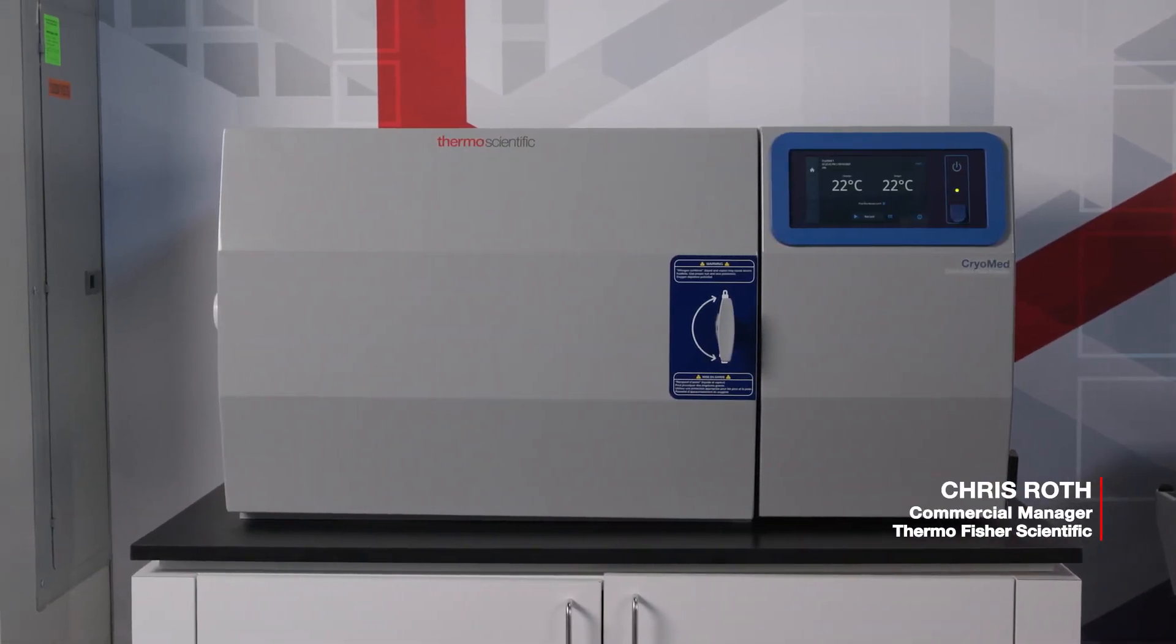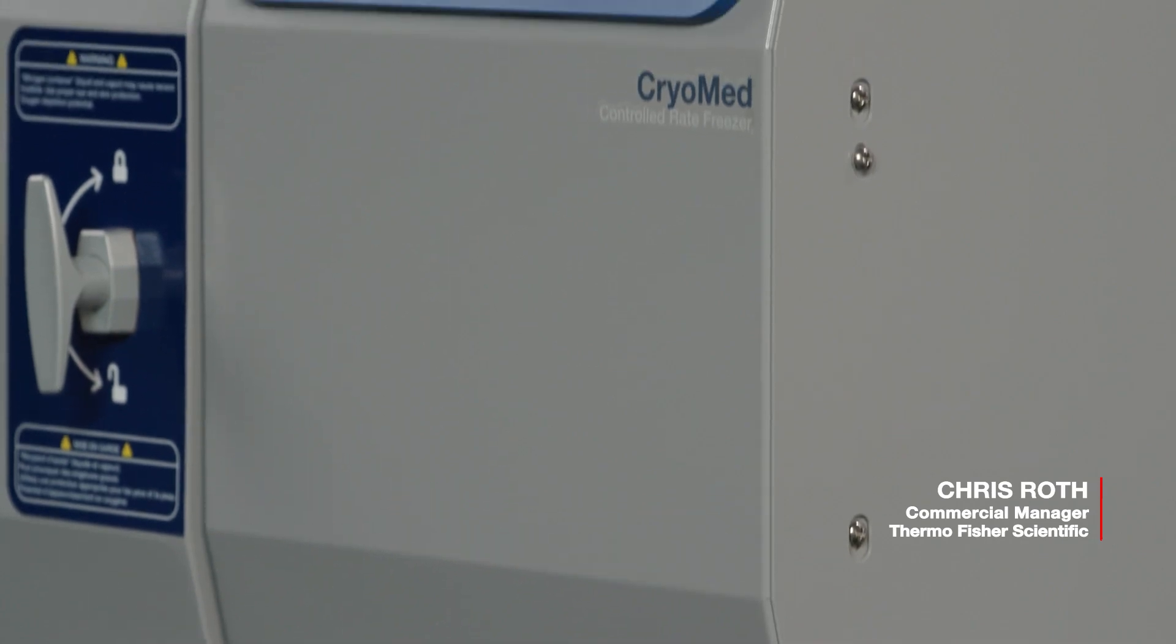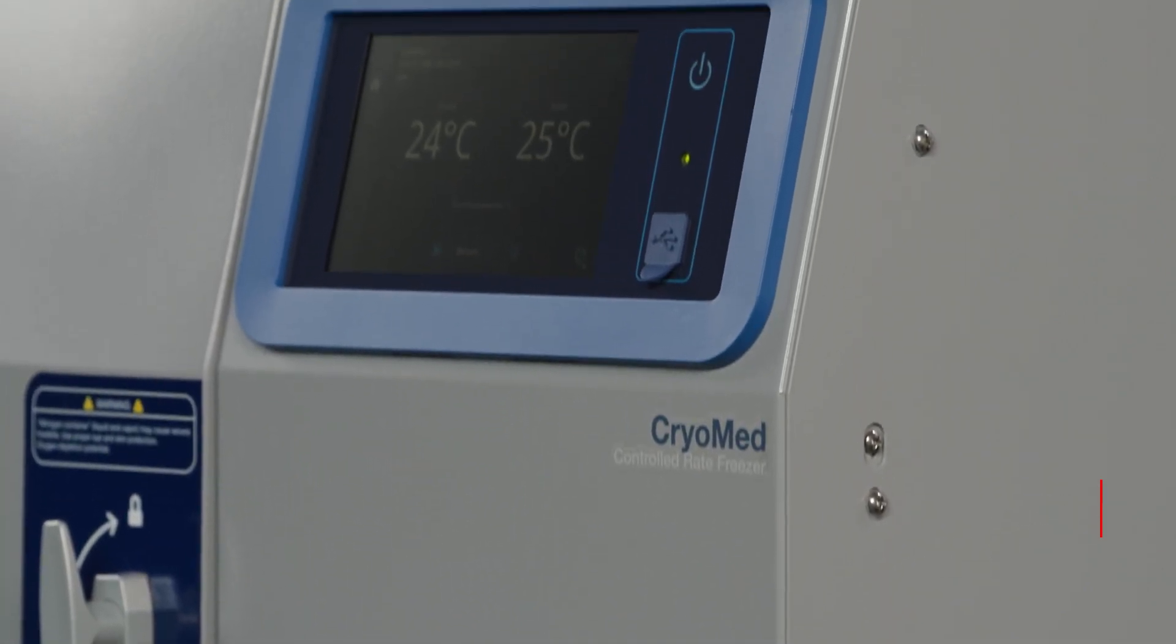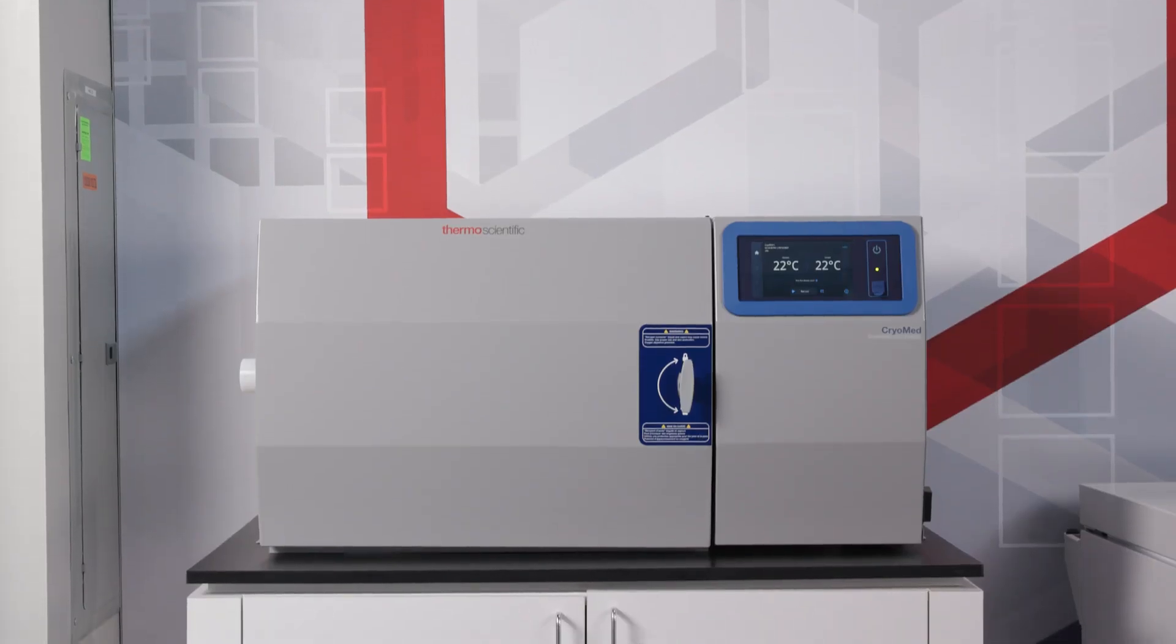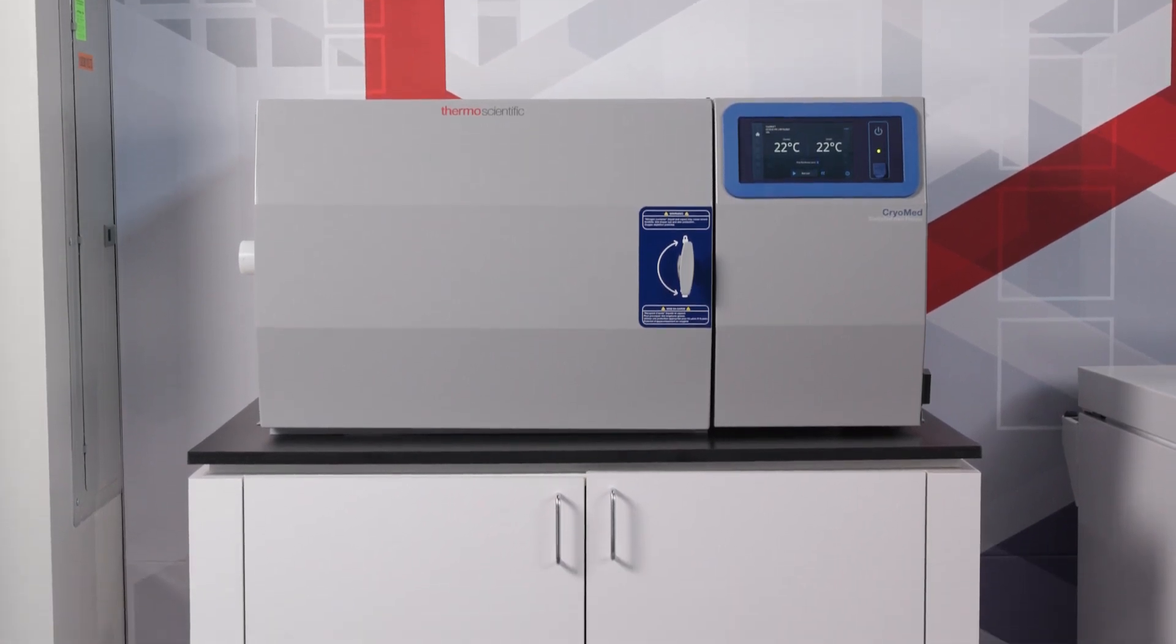My name is Chris Roth and I'm the commercial manager for cryopreservation equipment. Today we'll be walking through the preventative maintenance required for the Thermo Scientific CryoMed controlled rate freezer.